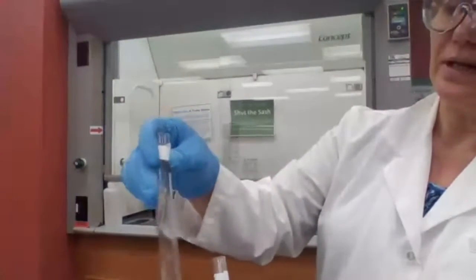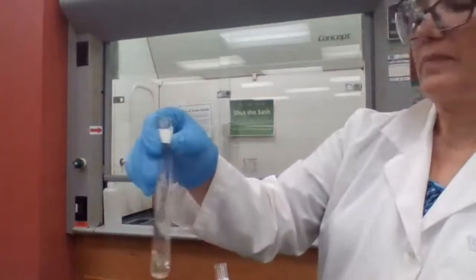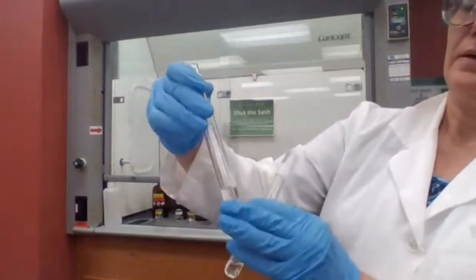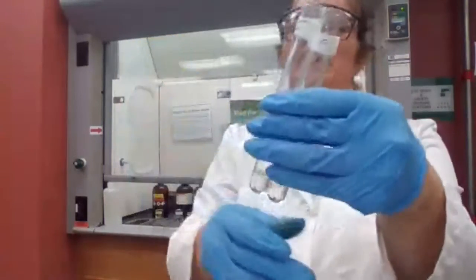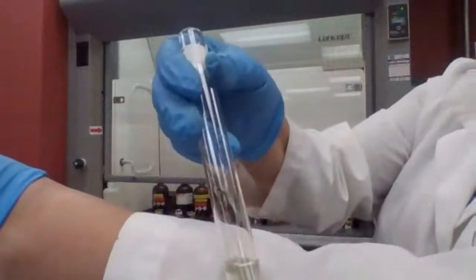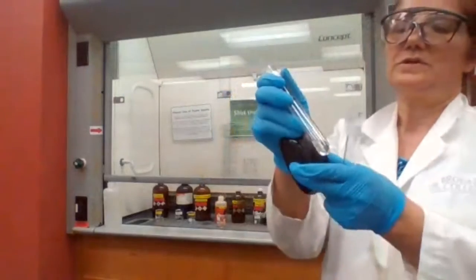For secondary and primary, there is no precipitate yet, but secondary is getting cloudy. I don't know how to show you, so you could see that there are some particles. Maybe a black background can help you to see it.